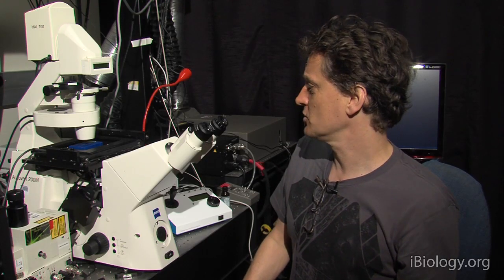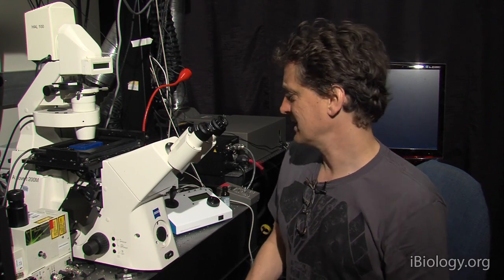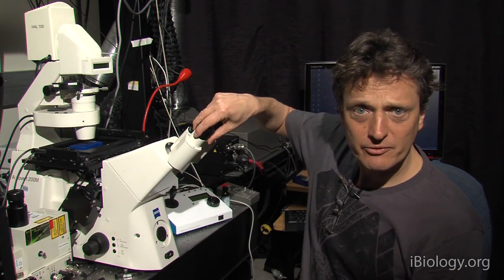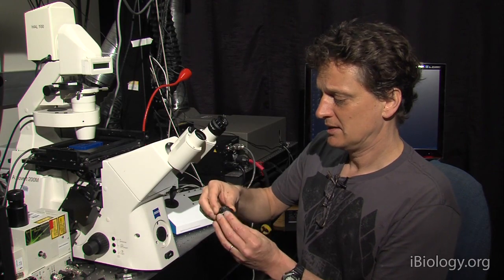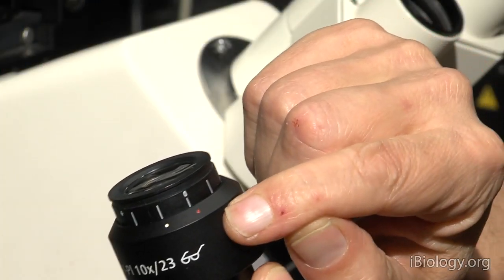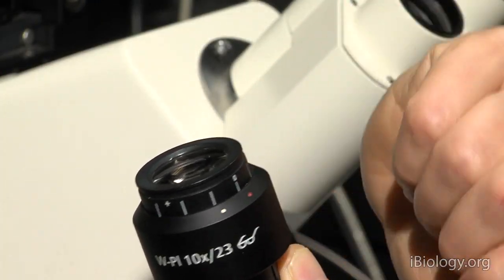But you will be focusing both eyes differently and that will not feel very good. And after observing through the microscope for a while, you will feel sick to your stomach. So, at the very least, before you start, make sure that the eyepieces are set somewhere in a neutral position.